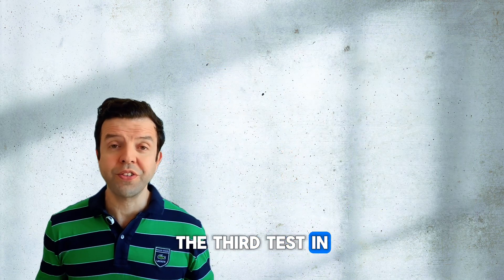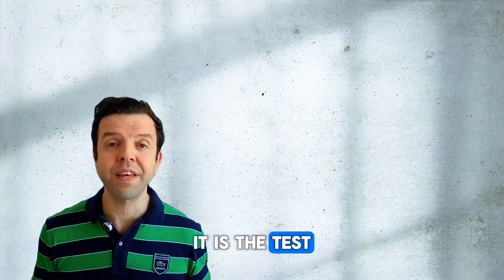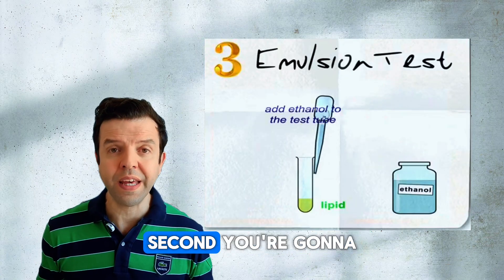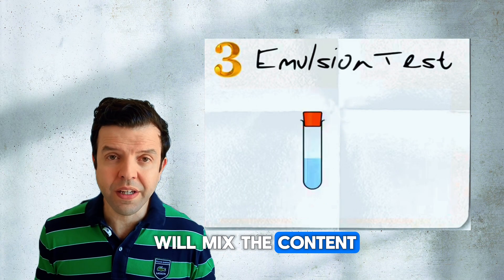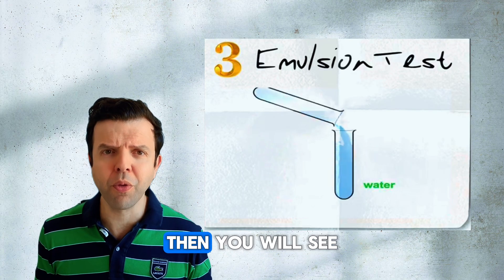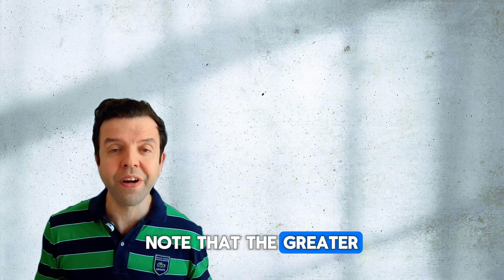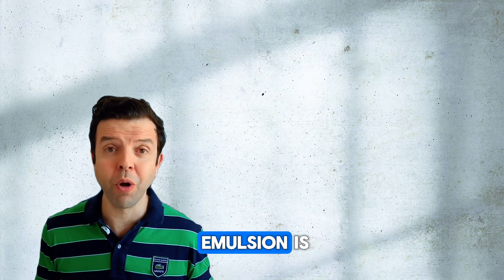The third test in our list is the emulsion test — it is the test of fats or lipids. First, you're going to dissolve the sample into ethanol. Second, you're going to add water and mix the content. If there are any fats in the sample, then you will see a white emulsion. Note that the greater the concentration of fats, the thicker the white emulsion is.